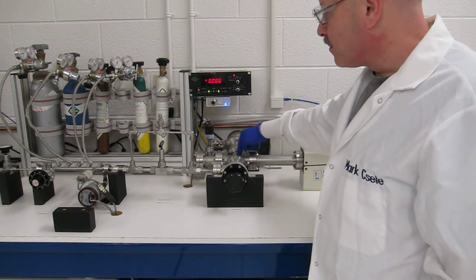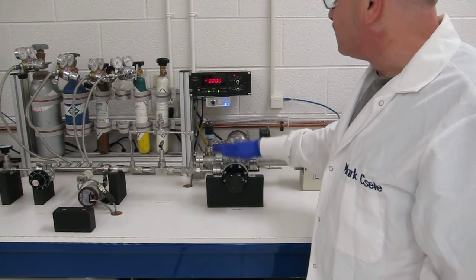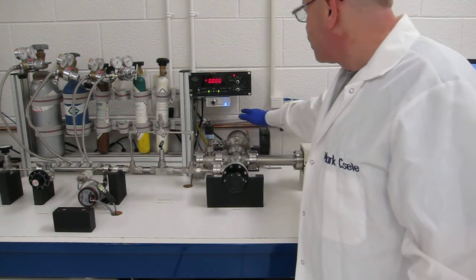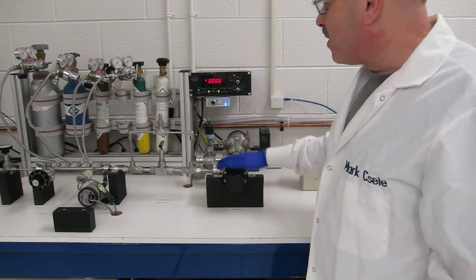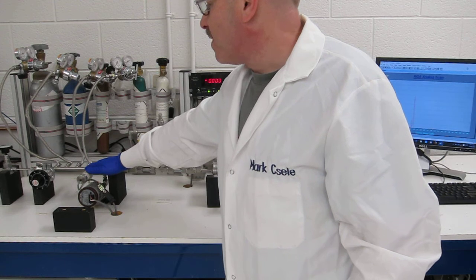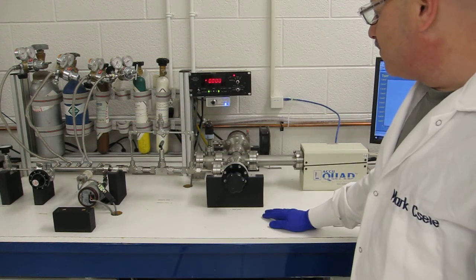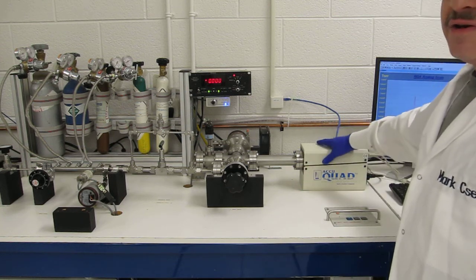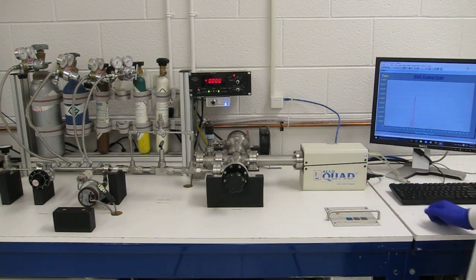inside it. In order to do a mass spectroscopy setup, the first thing you do is to evacuate the entire system to ultimate vacuum. That involves switching on the turbomolecular pump, leaving the RGA off, and opening all valves to the system so the manifold is taken down to what is otherwise a relatively high vacuum. Once you've achieved this high vacuum, you can run a background trace using a mass spectrometer to figure out what's left inside the system that hasn't been evacuated yet.